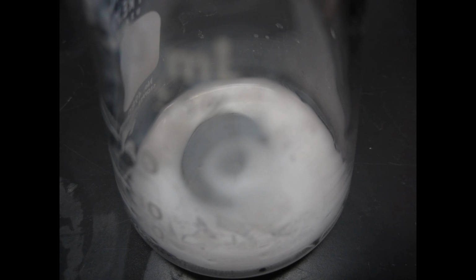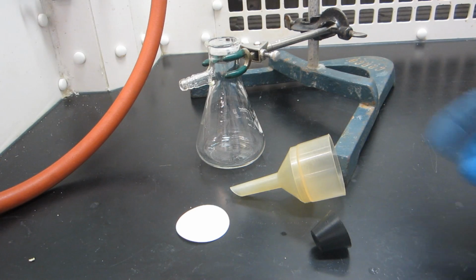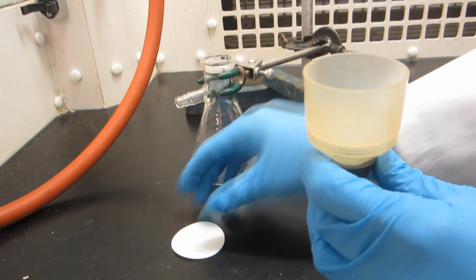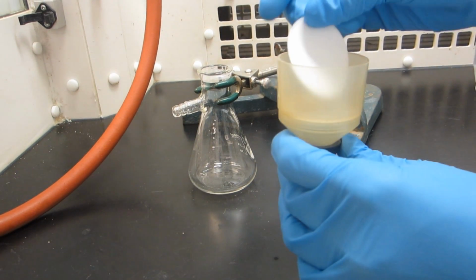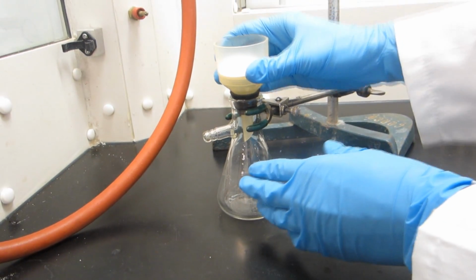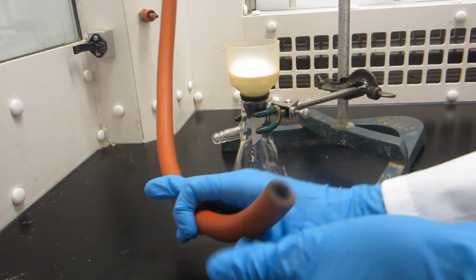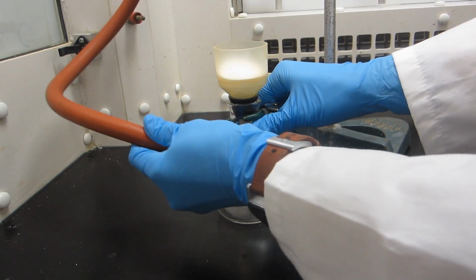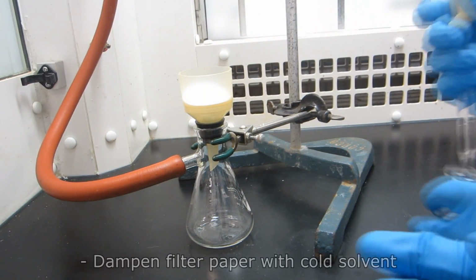Now that the crystallization is complete, the pure crystals can be separated from the solution by vacuum filtration. Obtain a Hirsch or Buchner funnel and place filter paper to cover the holes of the funnel. Attach a neoprene adapter to the bottom of the funnel and insert it into the top of a clamped filter flask. Attach thick-walled vacuum tubing to the filter flask and turn on the vacuum.